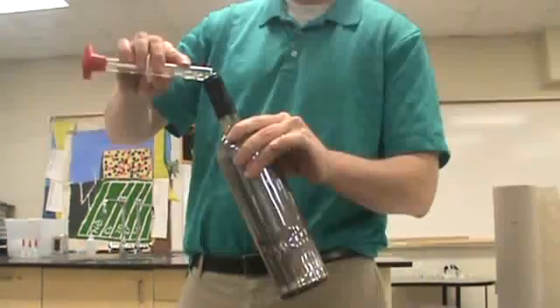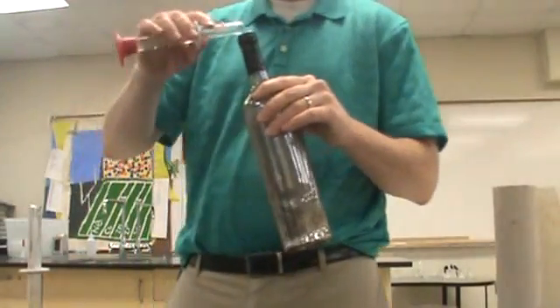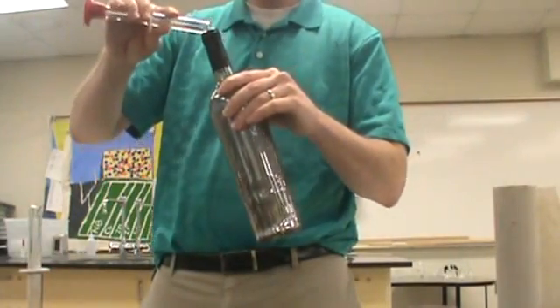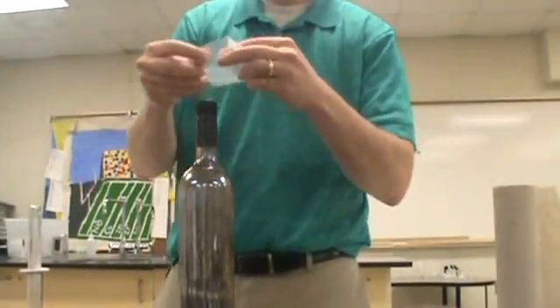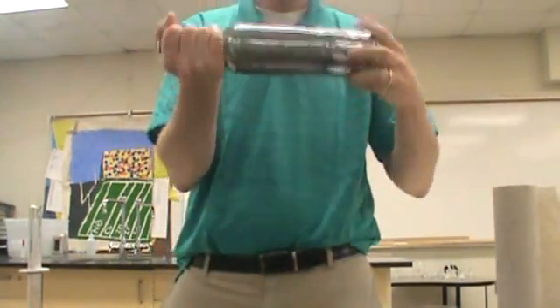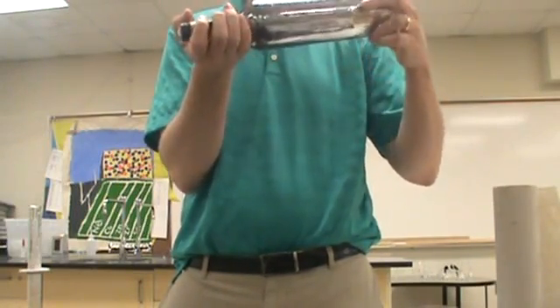So here's our silver nitrate, ammonium nitrate. Here's my sugar, dextrose. And lastly, we're going to put on the hydroxide. A little spill there. Before we get to that, put this around here as best we can so it doesn't leak. And we're going to start to coat this really nicely with silver metal.